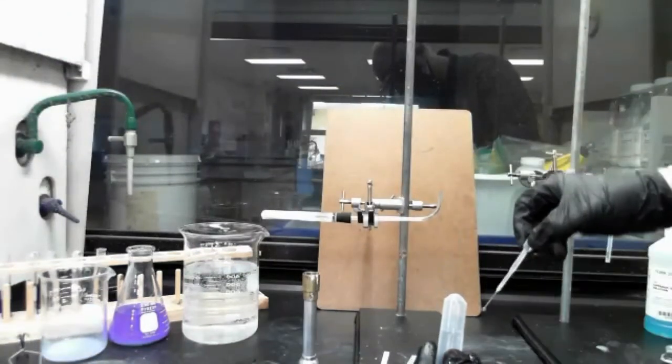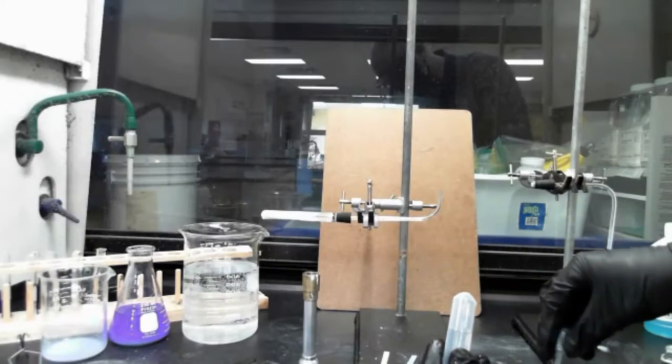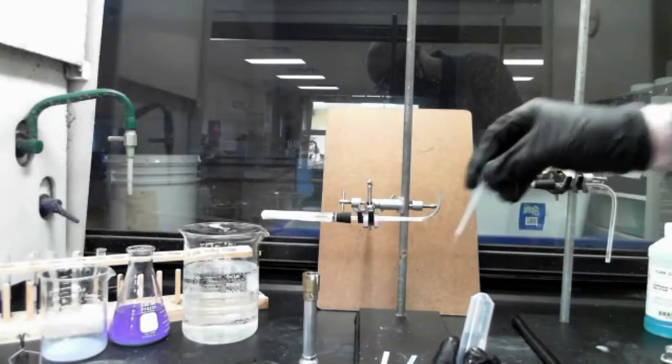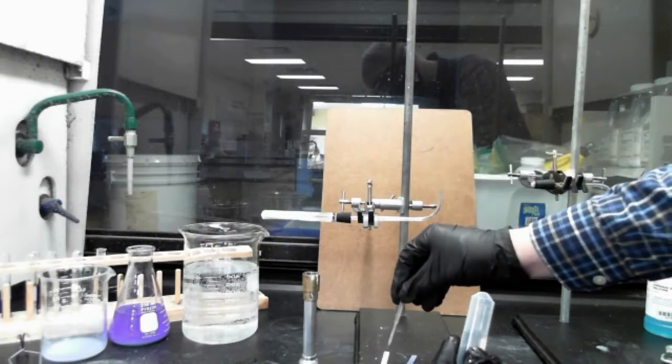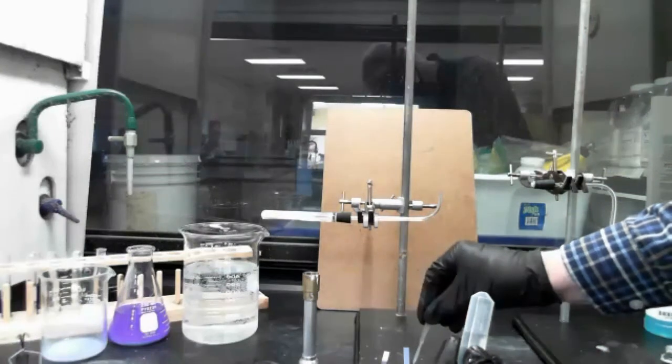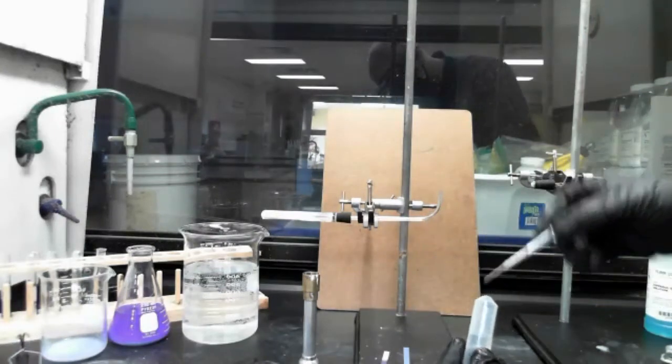I want to test this with this pipette bulb. I'm going to get some water here from this. I'm going to put some on the red and blue litmus paper.